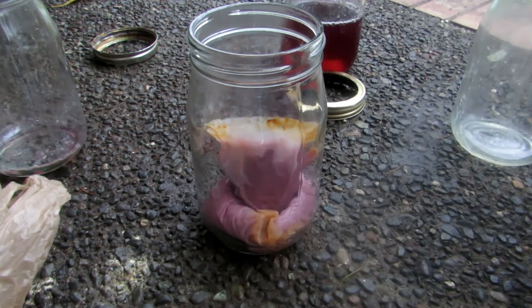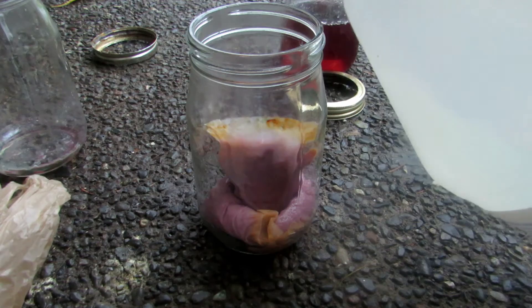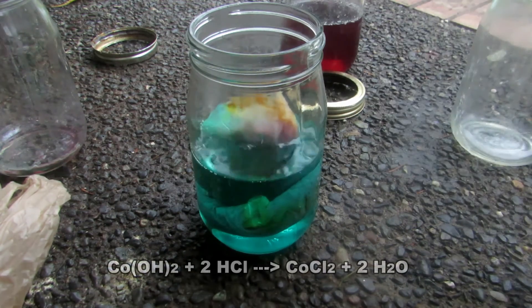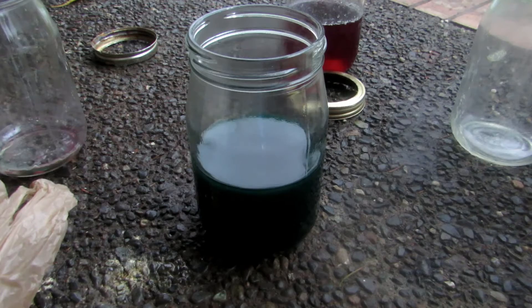I transferred all the remainder solution to the back for further processing later. With the cobalt hydroxide, we simply add hydrochloric acid — in acidic conditions the cobalt chloride produced will be blue, so we should see a nice blue color change. And yes, just as expected it has turned blue. Mix thoroughly to make sure all cobalt hydroxide reacts fully.